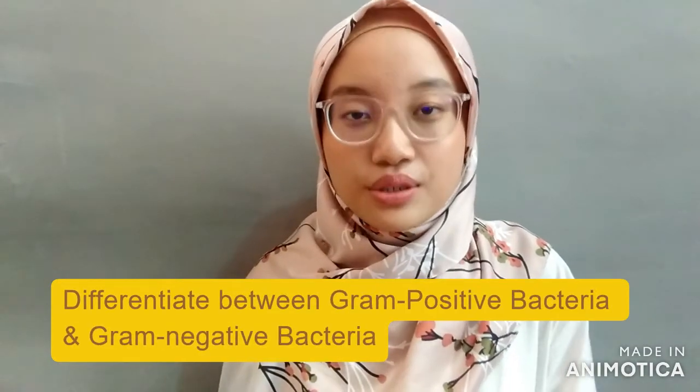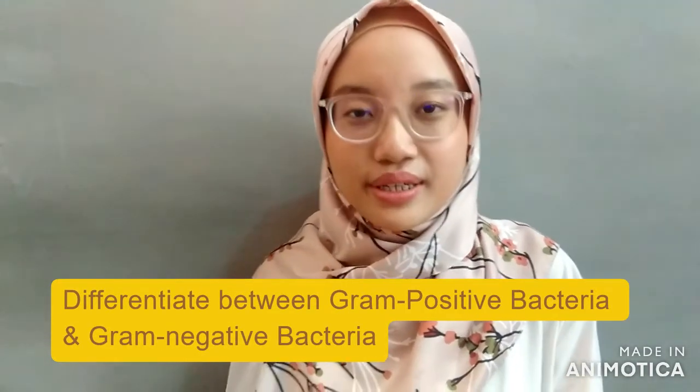Next, I'm going to brief you about the gram staining experiment, and I will show you the demonstration later. Scientists use this experiment to differentiate between two types of bacteria, which are gram-positive and gram-negative. In the expected result, it will show two colors of stained bacteria, which are purple-violet and red or pinkish.